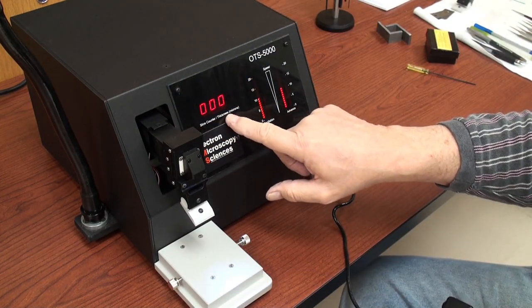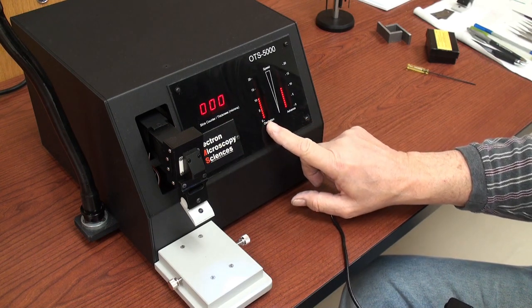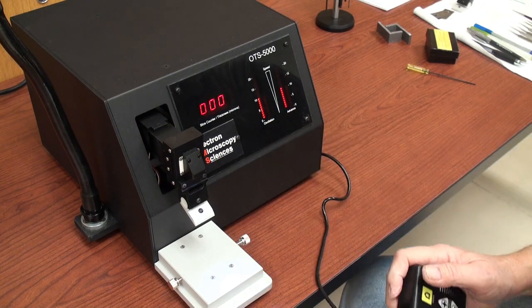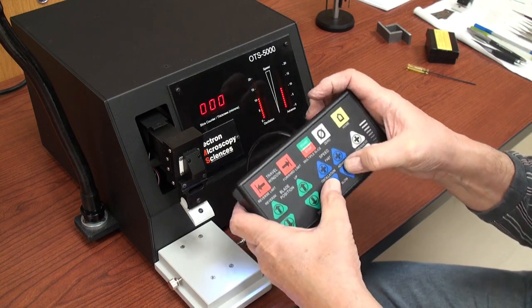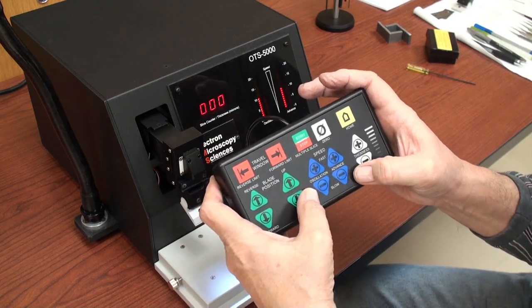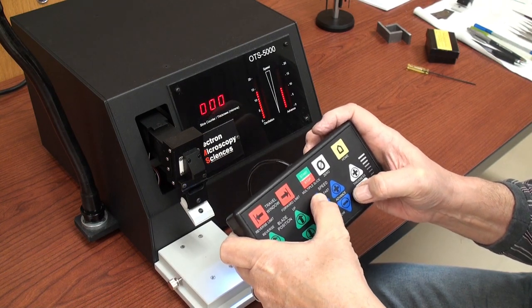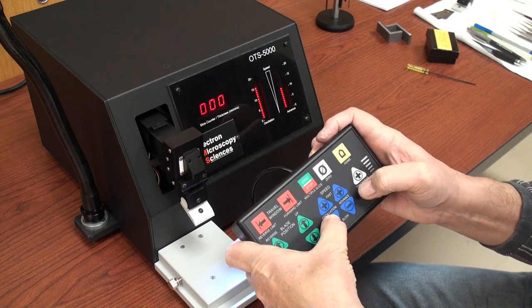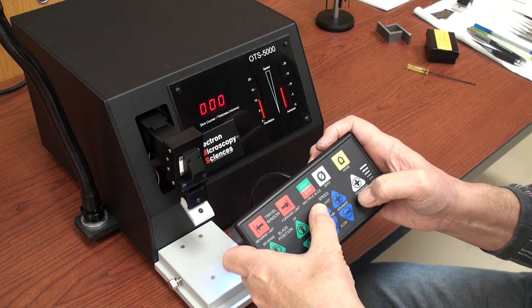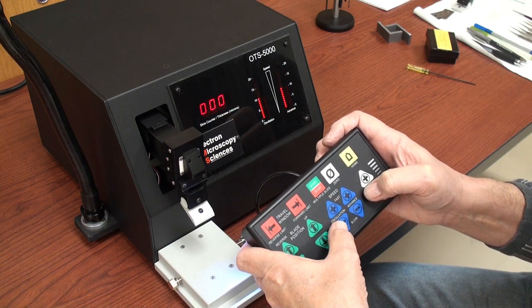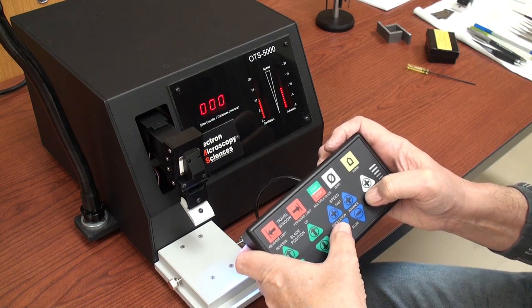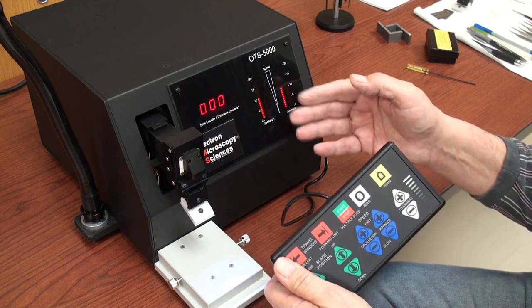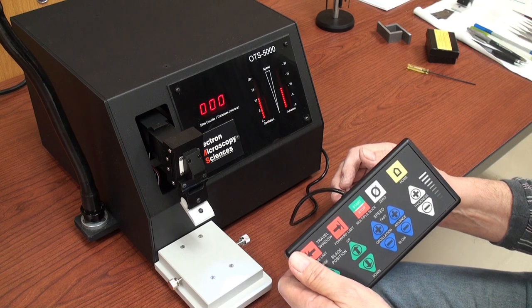The display has a slice and thickness counter. It has an oscillation speed and oscillation advance. And those are controlled by these blue keys here on the keyboard. You just can press them individually or press them and hold them. And it goes up and down according to what you're pressing. If it's flashing it means it's a half step. Non flashing is a whole step. My usual starting values are about 10 on both.